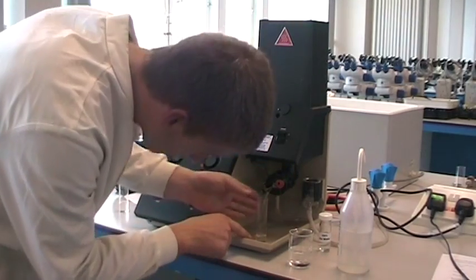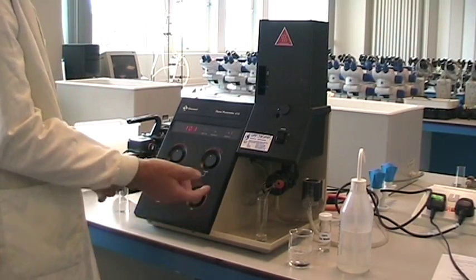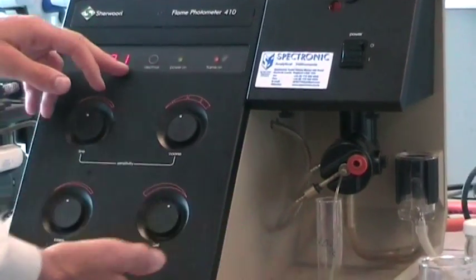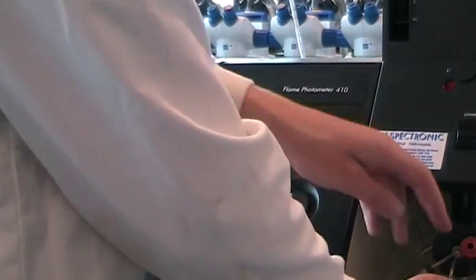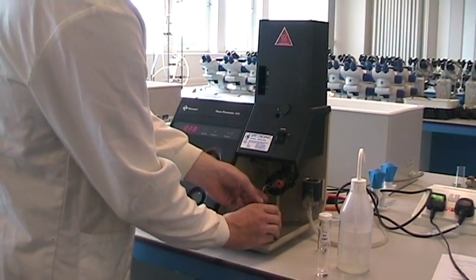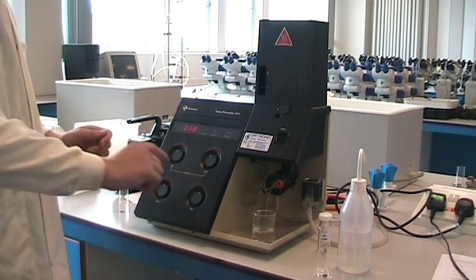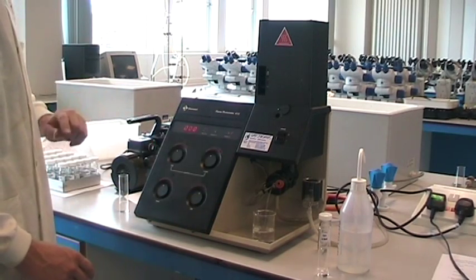Always make sure that the tube is in the solution rather than sucking up air. For example, it reads 80% but the photometer shows 101 — you need to record that value. For your calibration curve, you plot standard dilution concentration percentage along your x-axis and the reading from the photometer on the y-axis.